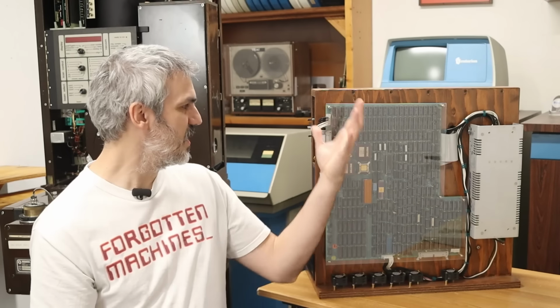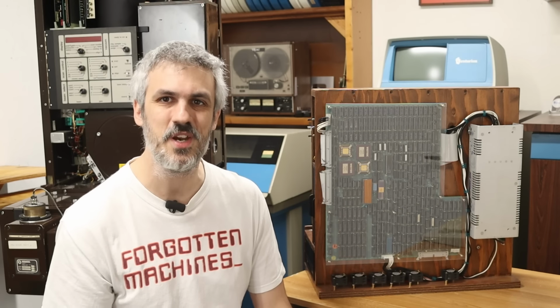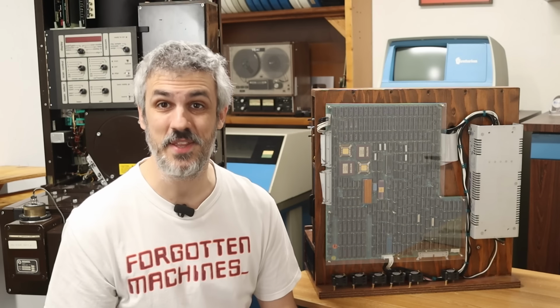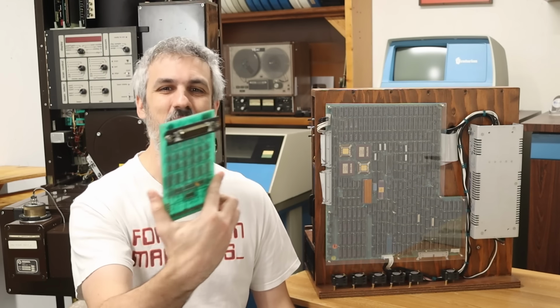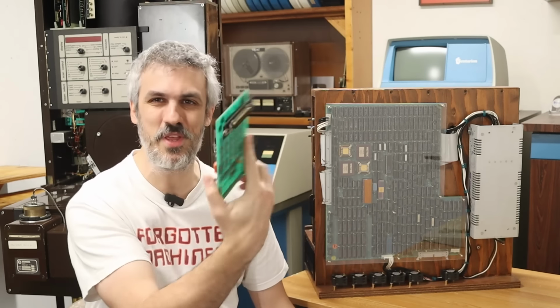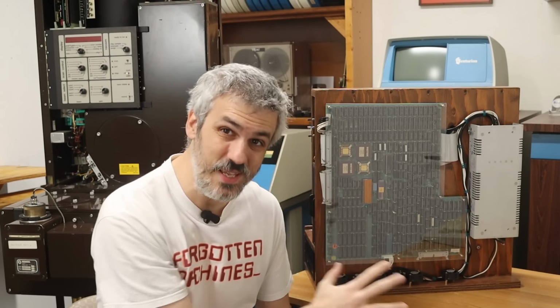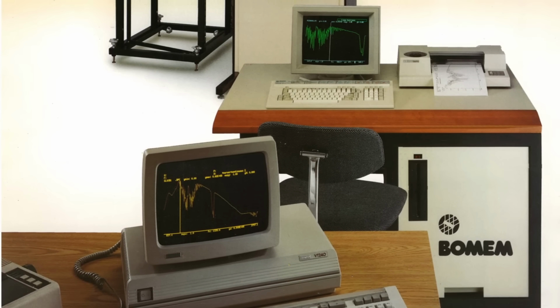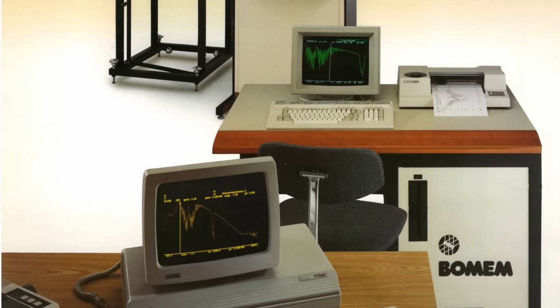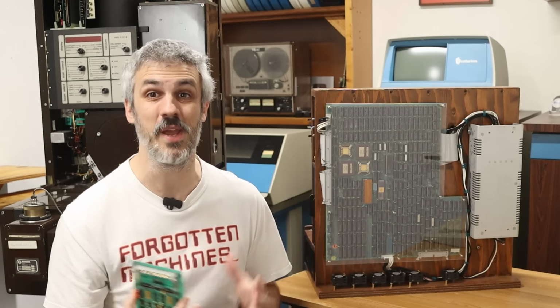When I built this case that's holding the PDP-1173 and the high-performance vector processor, I didn't have the Bomem DA-3 at that time, so we were just kind of building it to be standalone, and I didn't really plan for putting this in there, so there's not really any good place to put this. I think I'm going to tear this completely down and rebuild it properly into a desk like it's supposed to be. But we're going to do that when some other exciting stuff shows up in a couple of months. So for the time being, we're just going to do something a little temporary to get this plugged up so we can start making sure that everything works.